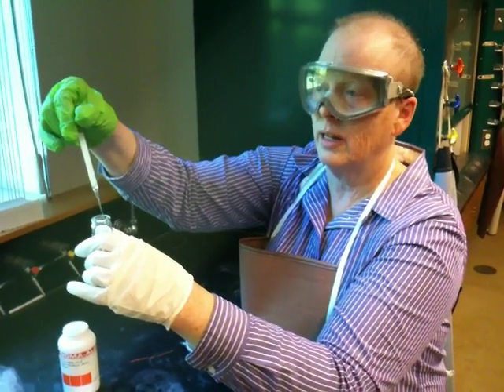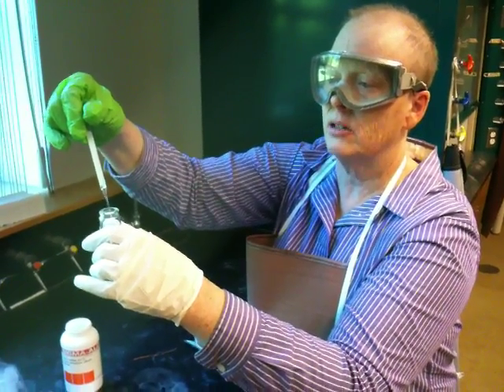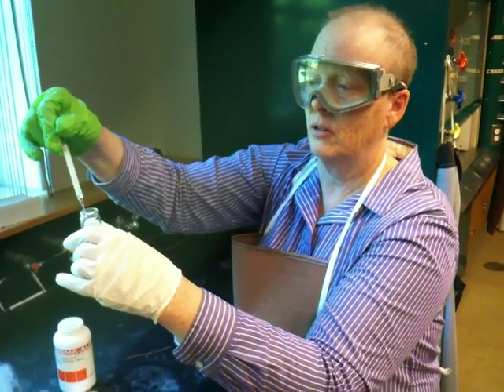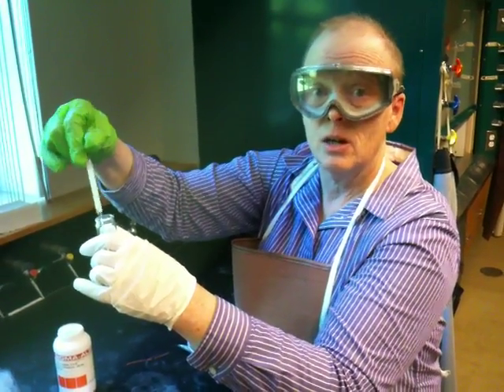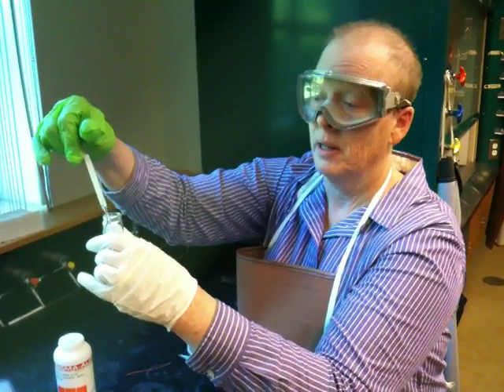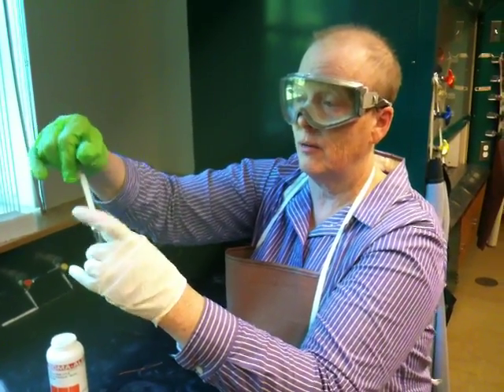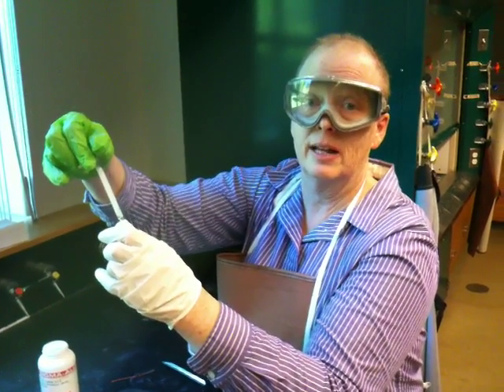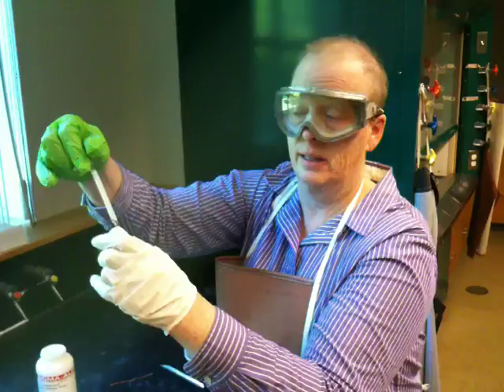Now what is this doing? As the liquid passes through the drying agent, it's picking up the water molecules. What is the advantage of this? We can recover much more material when we have a very, very small sample. And you would do this for the rest of your liquid, and at the end, give it some pressure and get the rest of the liquid out. And you'll actually get a very, very good recovery of your organic liquid.